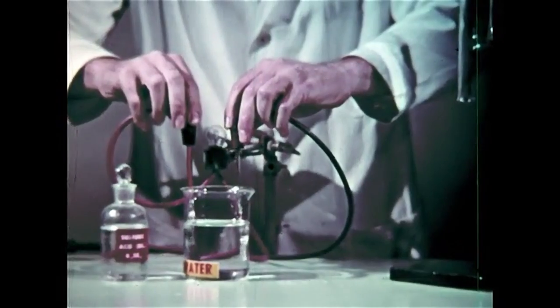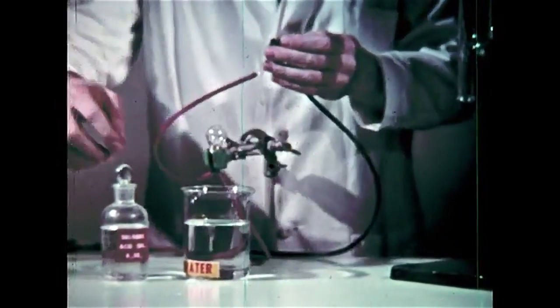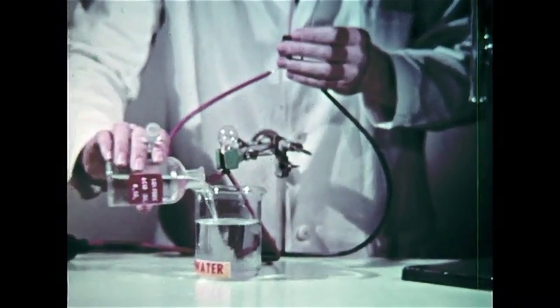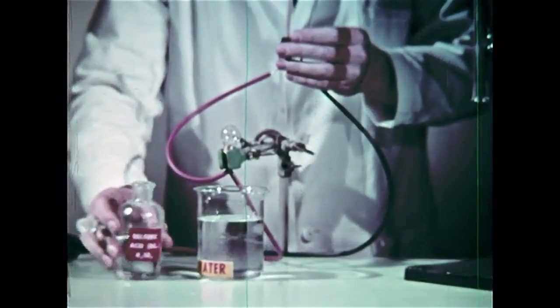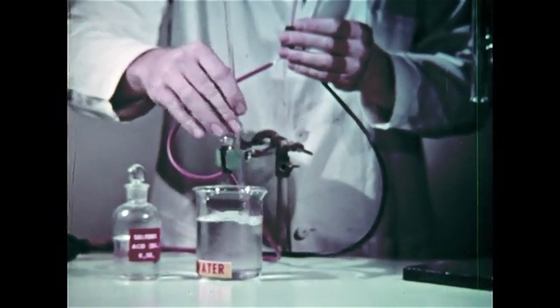However, distilled water does not pass a current, so we have to add an electrolyte, sulfuric acid in this case. The electrolyte provides ions which can move and allow the current to flow.